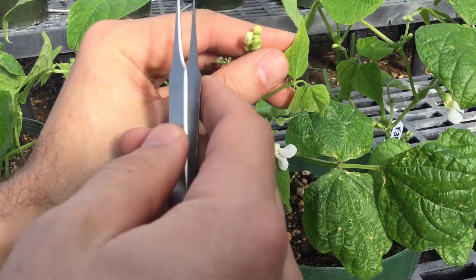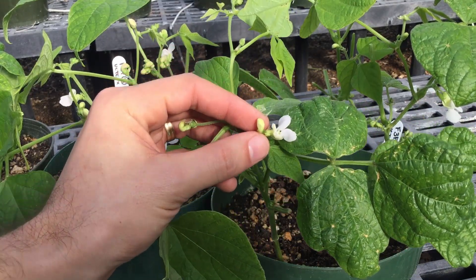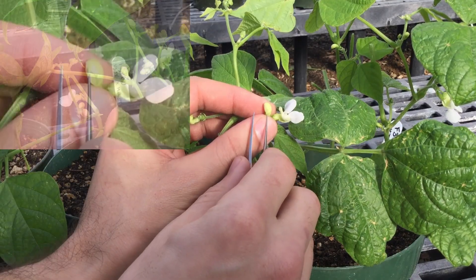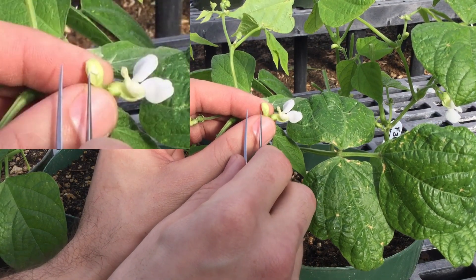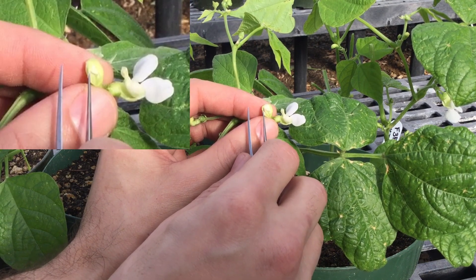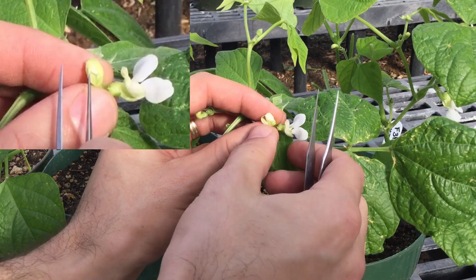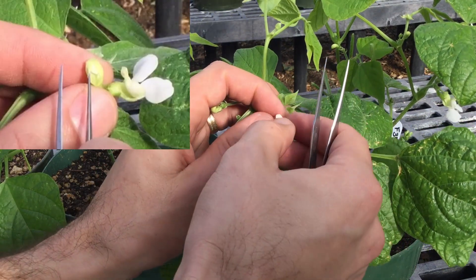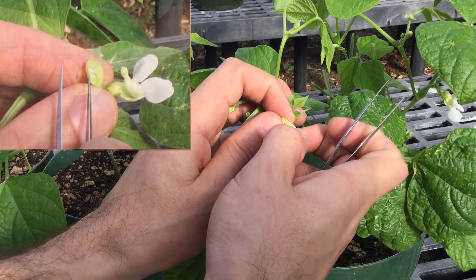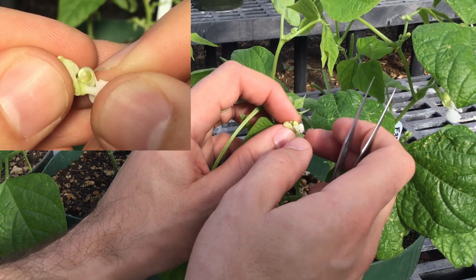We don't want to use anything that's too small. This is actually the flower we're going to start off with. We'll first hold the flower and then use tweezers to break open the petals from the bottom, go along here, and just split it right down the middle. Then push those to the sides, hold them on each side with our fingers, and pull down on these two petals, which are called the wings.